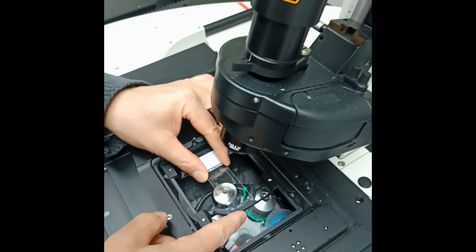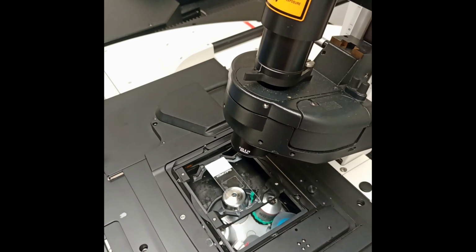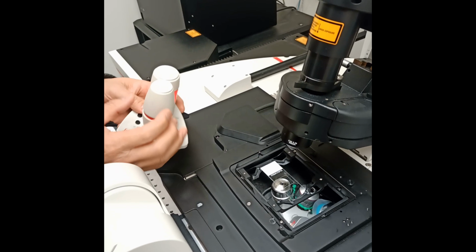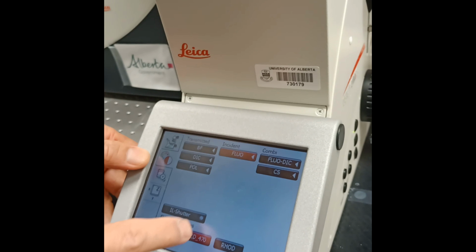One side of the sliders is secured while the other can be moved to slide your sample in and out. Move your sample to the outer edge of the holder and secure it with the movable slider. Move in X and Y with the controller such that the lens is facing your sample. Now, you can use the microscope display to start the fluorescence mode and focus on your sample using the oculars.